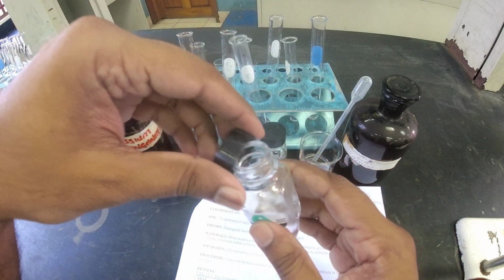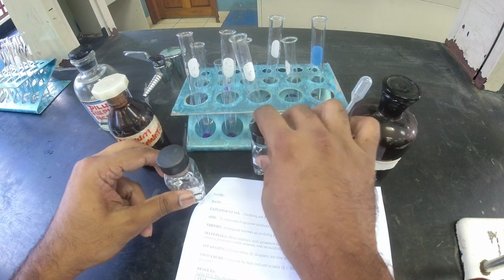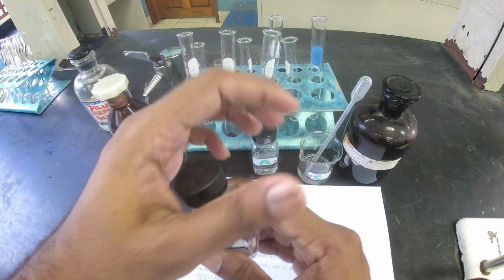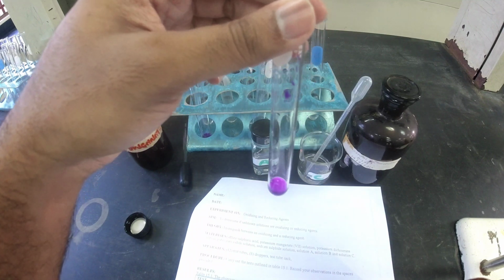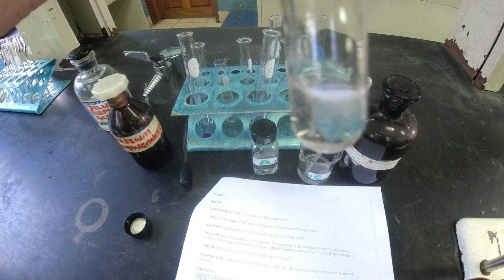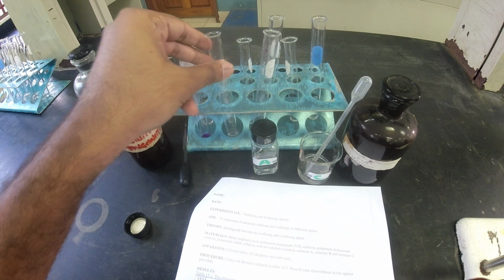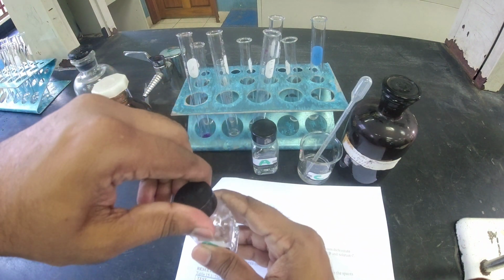Pouring. That's for A. Cover back A. I'm gonna place solution A by my first test tube. Let's do solution B. The second test tube. Initial color is purple. I'm adding in just a little bit, and you clearly could see the color went from purple to colorless there. Purple to colorless. That's the observation for B.